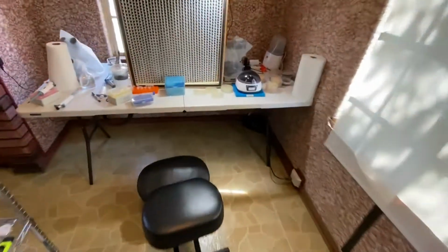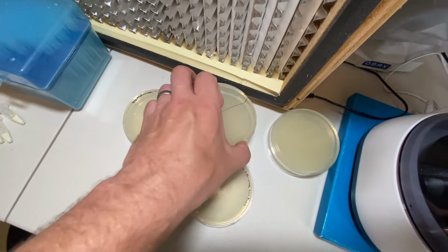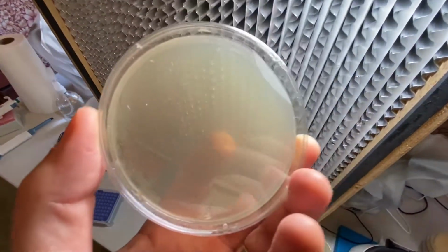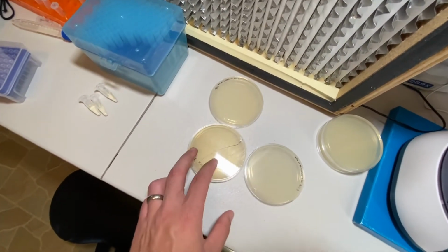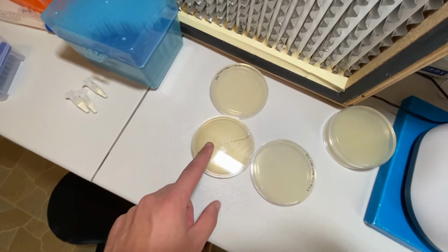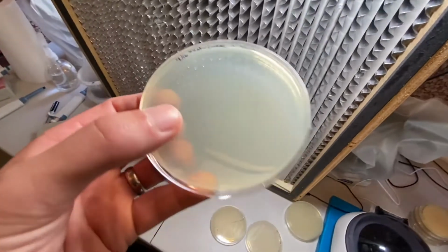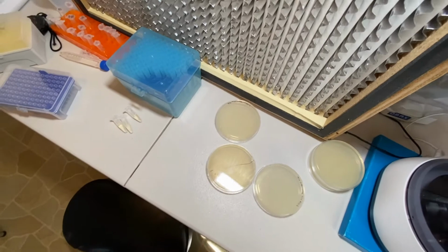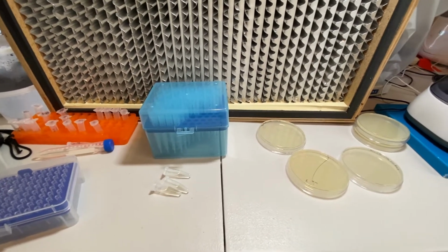The other thing that I need to work on is my spreading technique, because having some of these which didn't have any successful transformants but showed some cells around the outer edge tells me that I'm not getting the kanamycin all the way around the edges. And that's not the end of the world, but it can cause false positives. And really what we want to see is a plate full of colonies that have been transformed. And that's ultimately the final test of success on this. We'll test those two things, and then we'll go back to running our tests.